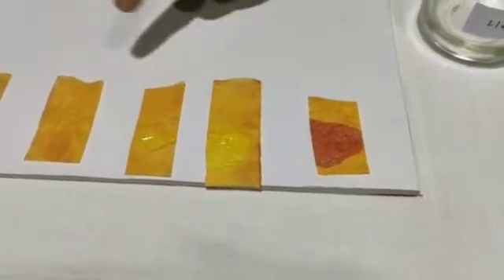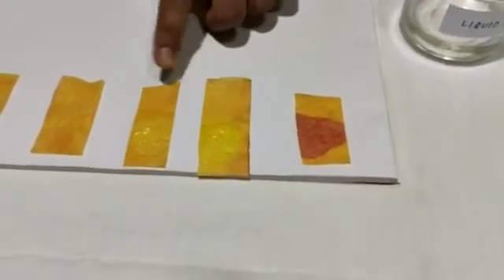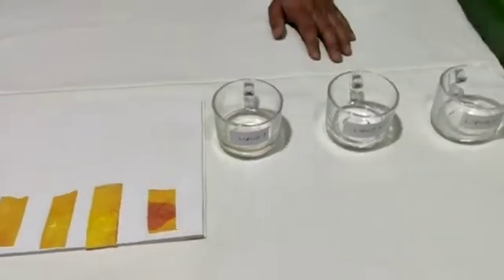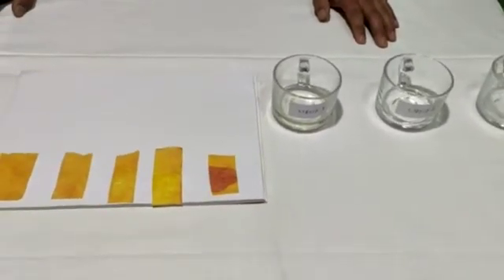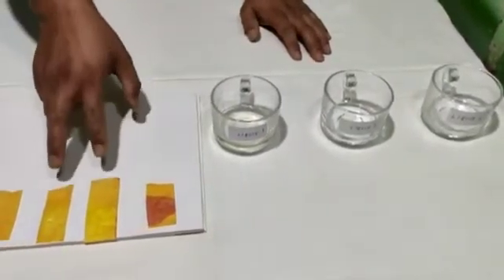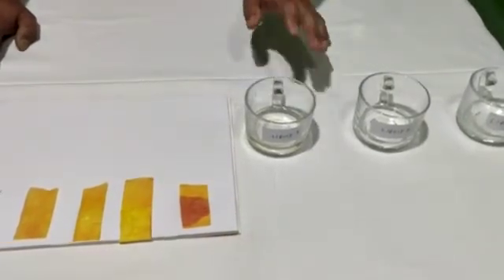Now let us see what is going to happen on these turmeric indicators in terms of color. We have seen that on this turmeric indicator, the yellow color turns red. On the other hand, on these two indicators, we don't see any change of color. From this, we can say that liquid 1 is a basic solution, because a basic solution always turns the yellow color of the turmeric indicator red. So this is confirmed — this is a basic solution. However, for these two indicators with no color change, we still need to find out which one is the acidic solution and which one is the neutral solution.